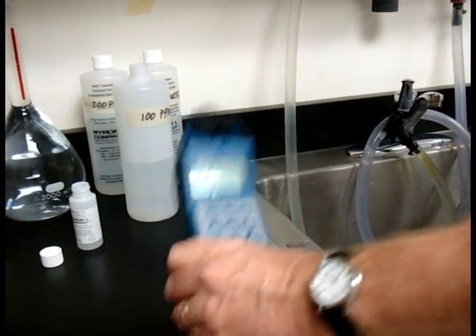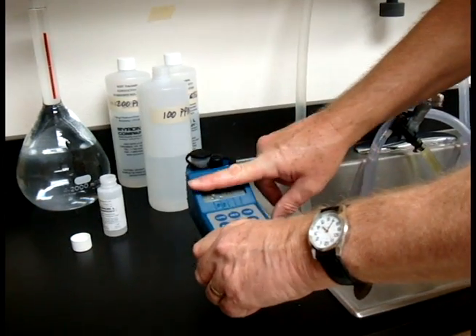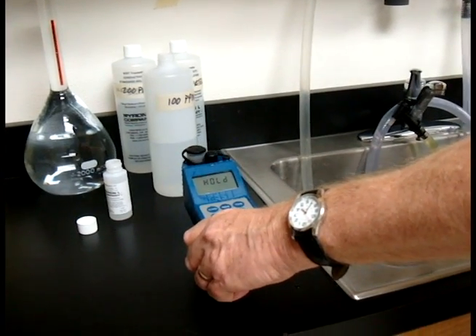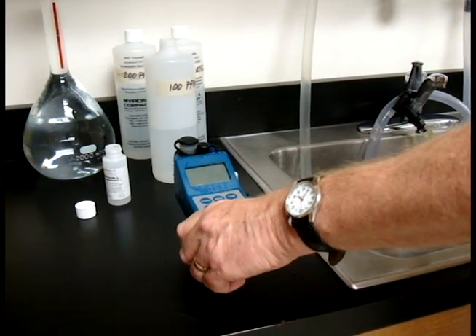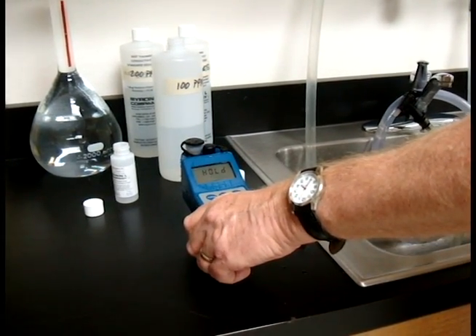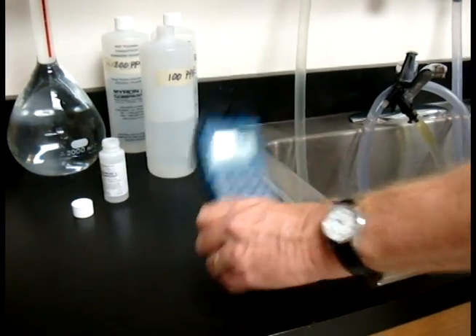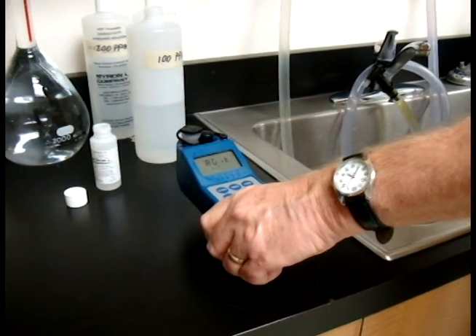And it's going to say agitate. Now when you agitate, you just need to do it three or four times and hold it. It'll ask it again. Agitate. You can see I'm not shaking it very much, just a little. And then holding.